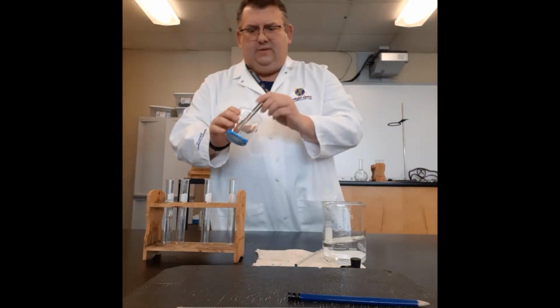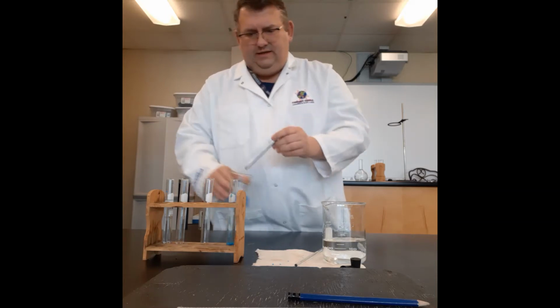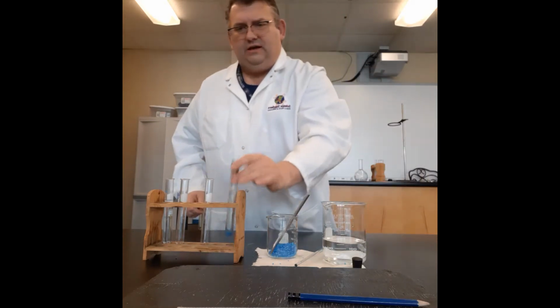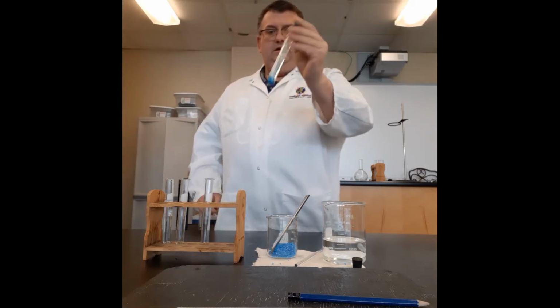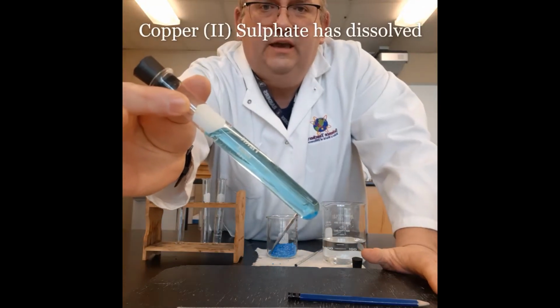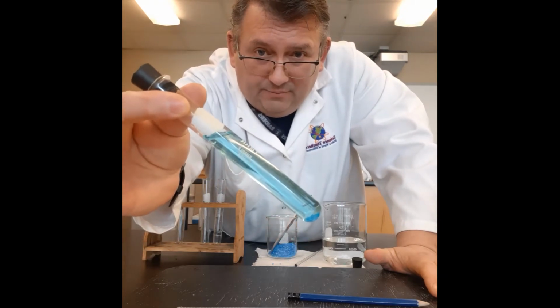I'm going to take my copper 2 sulfate, and I'm going to put a scoop of copper 2 sulfate into there. Then I'm going to take a stopper, put it on lightly, and gently give it a shake until the copper 2 sulfate dissolves. If we look here, we can see most of the copper 2 sulfate has dissolved, and we've changed the water to a blue.